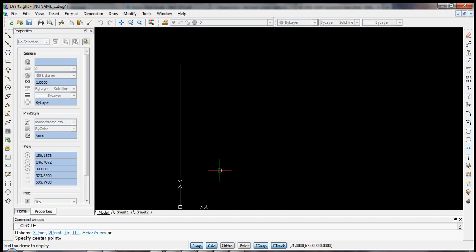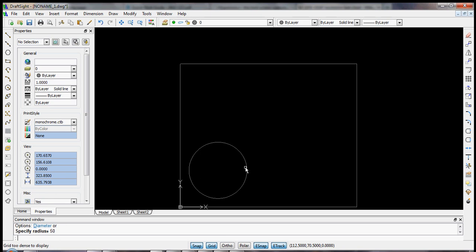And you can see down over here at the bottom, you see your dimensions of the cursor. We could try to line up 65, 65, but we can also just type it in. 65, 65. There we go. And again, we want it to be 50 millimeters in radius. We can just type it in, 50. Okay, good. So here is our first mask position, and we should be able to get 5 masks on here.